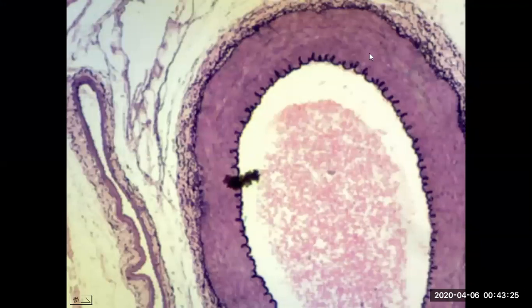So we have an artery here to the right side, and we can see the open lumen here, still filled with some blood cells. Whereas here to the left side of the screen, we have a vein, and due to the thin structure of its tunics, veins tend to fold and collapse when there's no blood, when there's no pressure. So that's what we're seeing here, the thicker rounded artery. But again, they both have a hollow space, and that hollow space inside is the lumen.